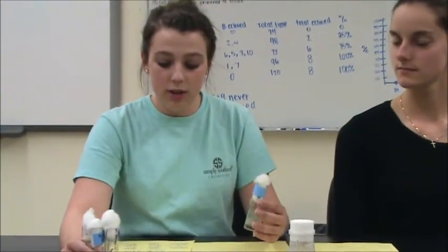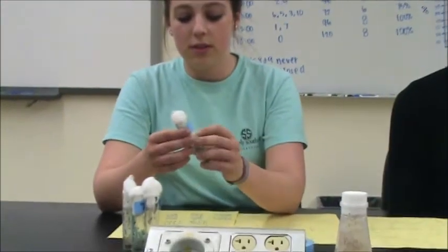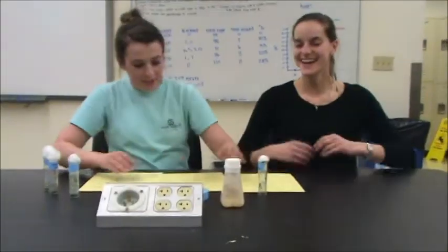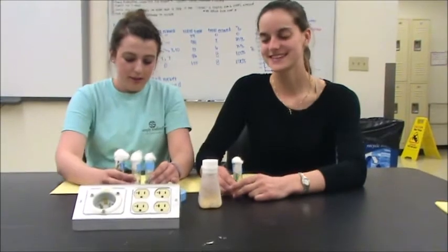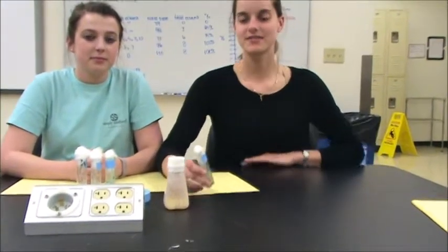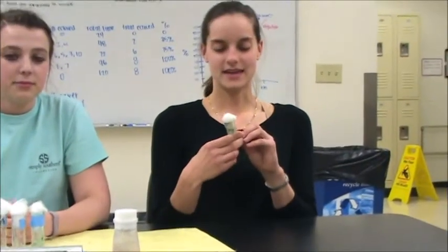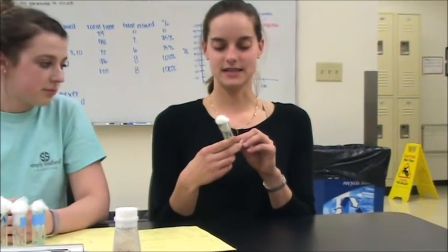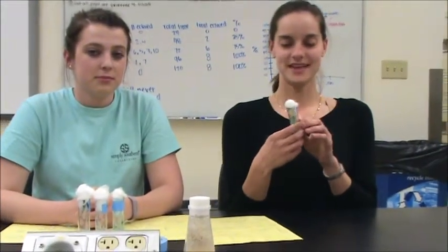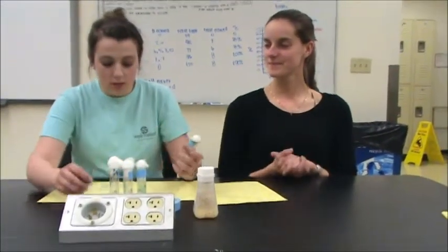First, we're going to start with multiple vials of larvae, and you're going to have labels with the different diets. So like here we have high sugar, here we have high fat, and here we have high protein. Once the food is in the vial, then you put the larva in it, and then you mark them every day. You see them climb up the walls and make a cocoon-like thing on the side of the wall. And do you want to tell them how to mark it?